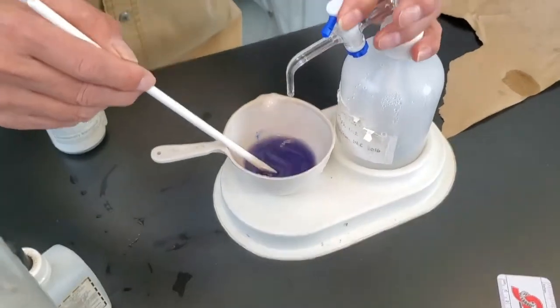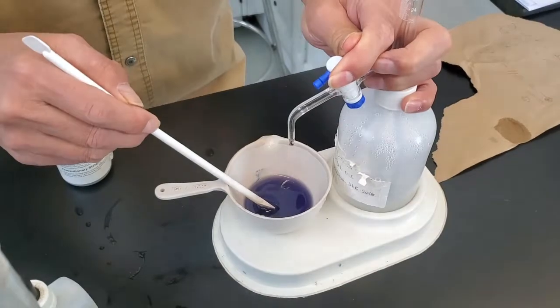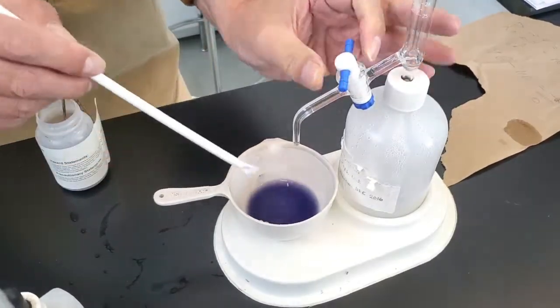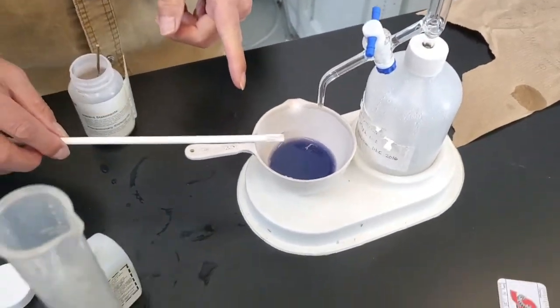Now, I think that's it. One more drop, it's probably quicker. Okay, so something like this. That is the end point. Okay.